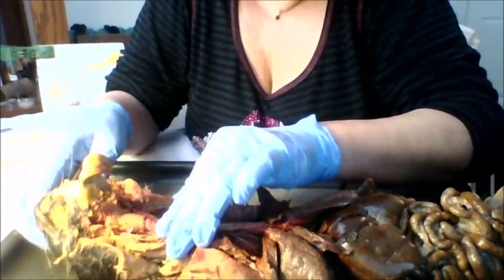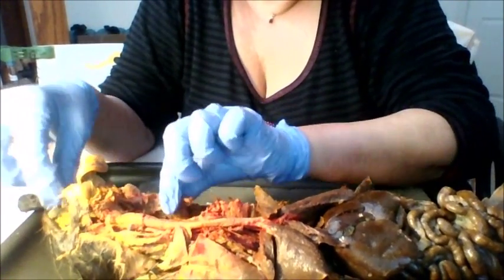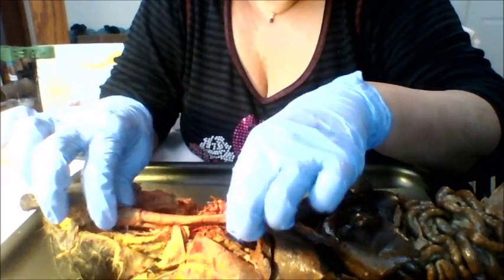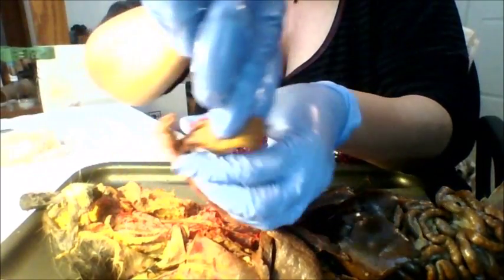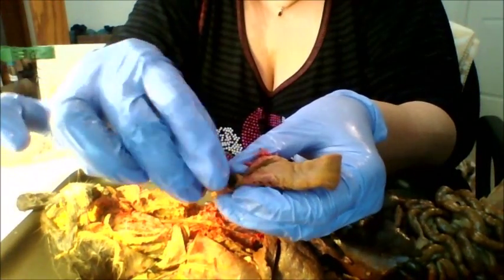I'm with Jacksonville University, and I'm going to share an overview of two classes that we've been going over, two labs, respiratory tract and the digestive system, the cat. So we're going to start first with the mouth. And I'm not going to go over teeth and all that stuff, although that is part of the lab, knowing the canines and the molars and such on the cat. But we're going to start with the tongue and the soft palate, the upper palate.